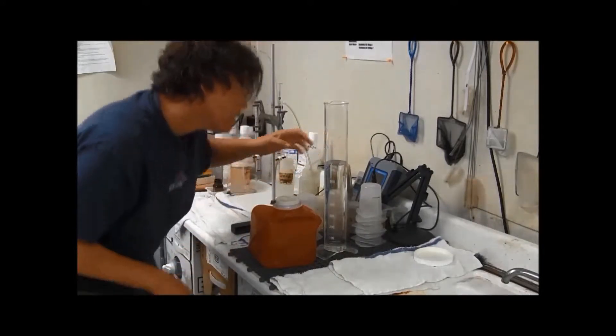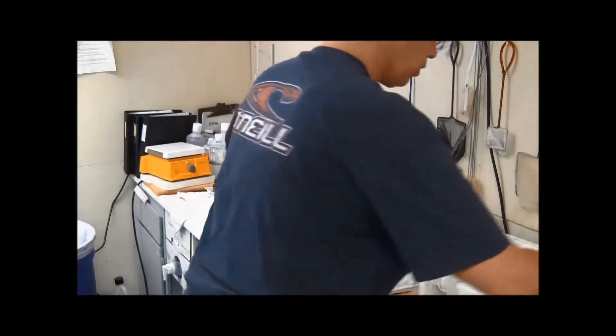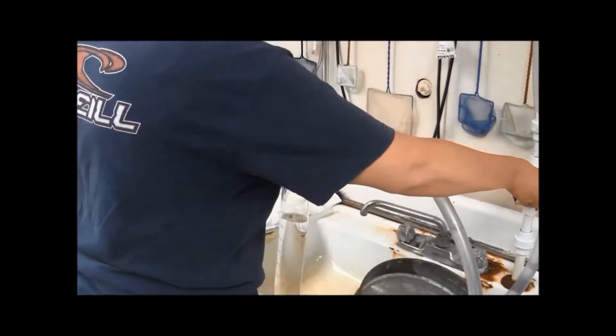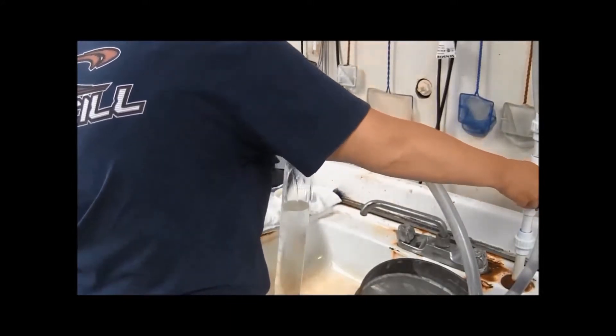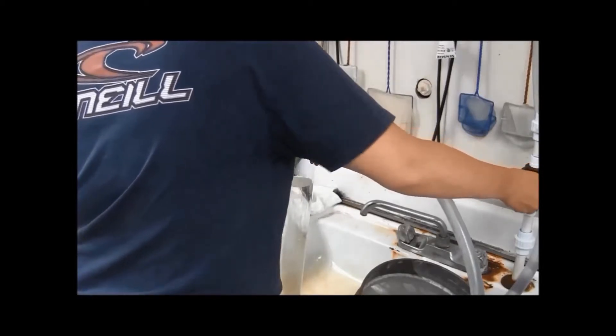I've got it right there at 750, and I'm going to fill the rest with water. Generally, we use DI water, but you don't have to. And you're going to fill it all the way up with water to where you get to 1000 milliliters.